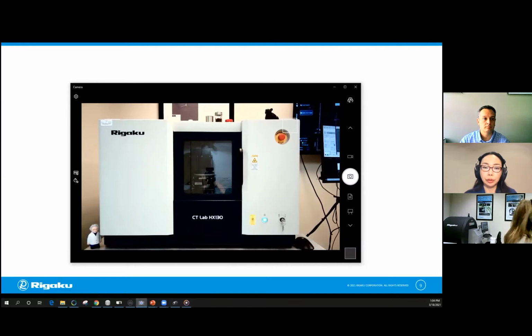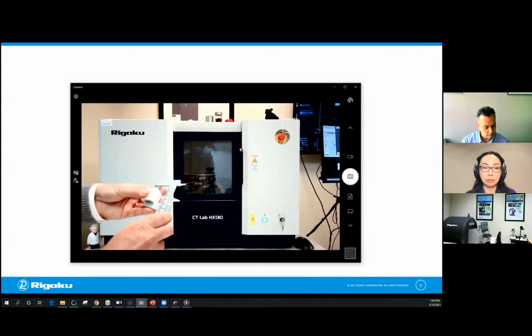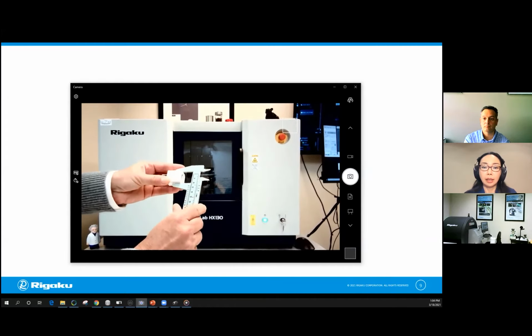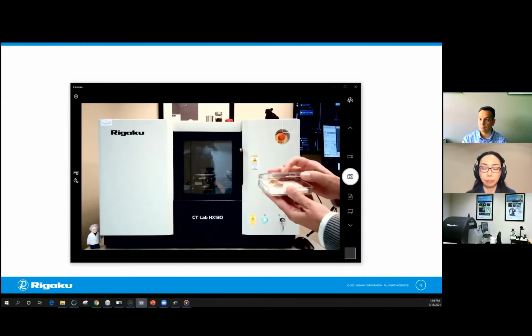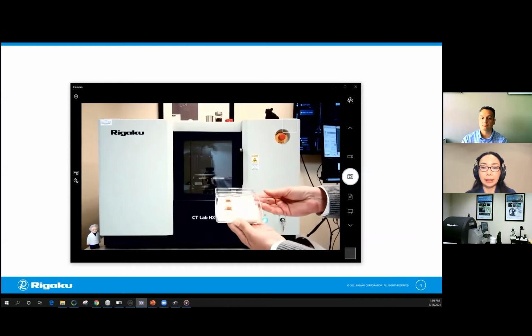So which filter and data collection setting is best for this sample? This Apple plug, plastic and a metal. We could use either no filter and 60 kV setting. She's showing you how big the sample is. Okay. And you could use maybe copper 0.2 millimeter filter and 130 kV setting. This 130 kV, by the way, is the voltage you can apply to the X-ray generator. You could also use aluminum 1 millimeter filter and 90 kV.